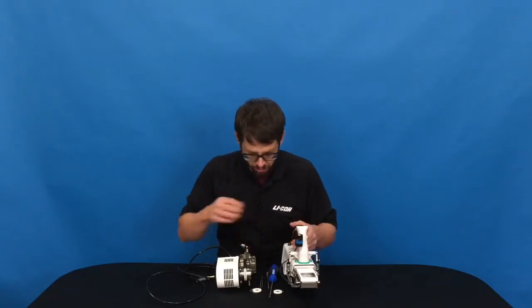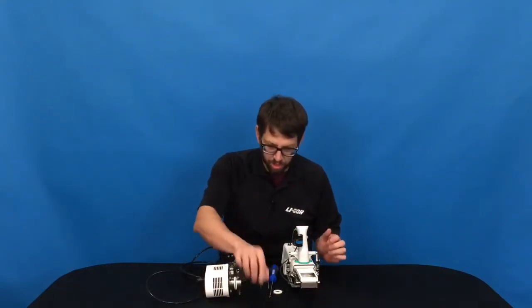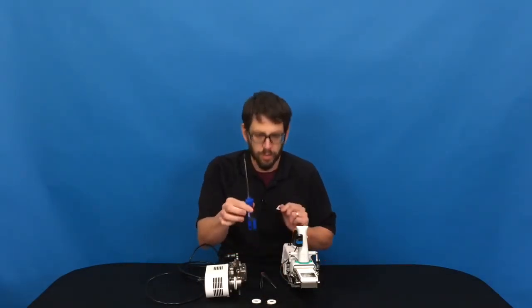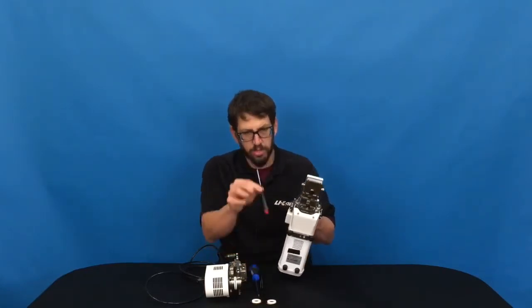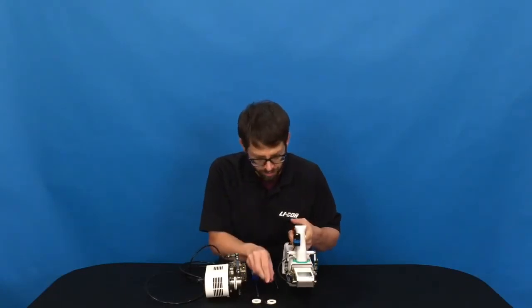For this task we'll just need the fluorometer, whichever apertures you're going to install — which I'll talk about in a minute — and you'll need a number two Phillips screwdriver. If the skid plate is on, like it is here, you'll need a smaller number one screwdriver, and sometimes tweezers can be helpful to grab screws.